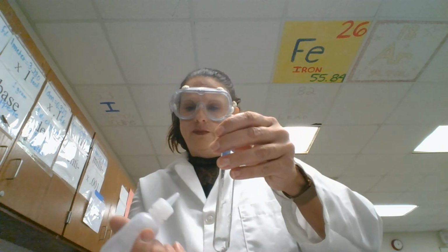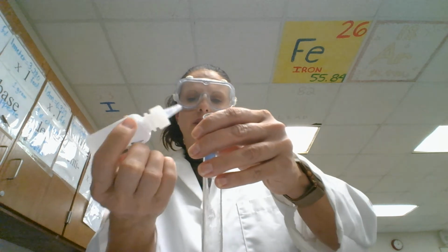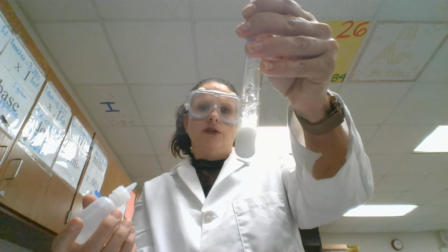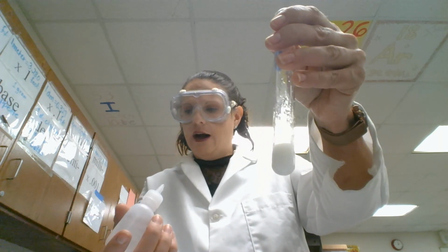And last but not least, the barium nitrate, mixing it with sodium carbonate. So you see that all of the alkaline earth metal compounds react in a similar fashion with the sodium carbonate. So at this point, you'll want to make sure that you have all of your observations filled in on your table, and you can now go to work on your conclusion and also your sources of error. Thank you very much.